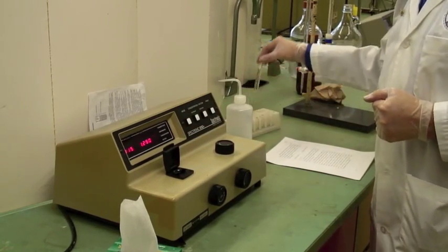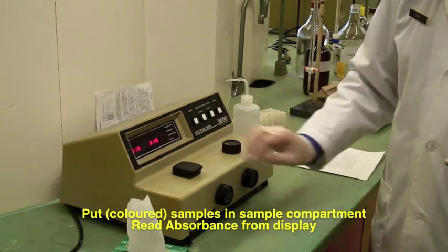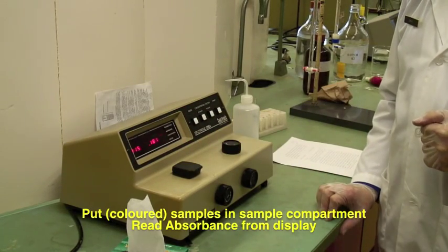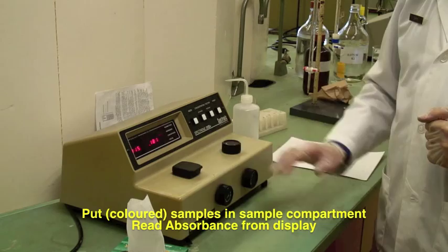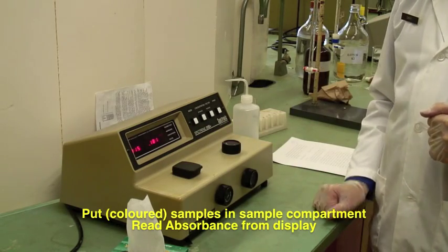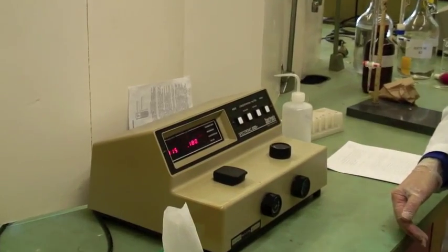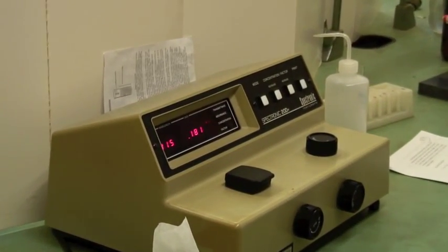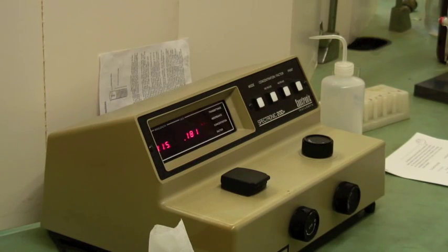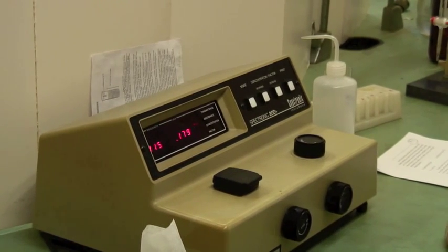Take one of my iodine solutions and pop it in. Let this stabilize — it has an absorbance of 0.181. You will make up a series of six or seven different concentrations of iodine with different absorbances, and you'll construct a calibration curve.